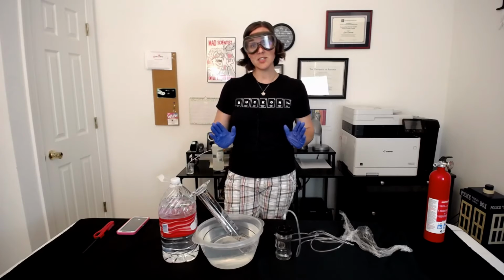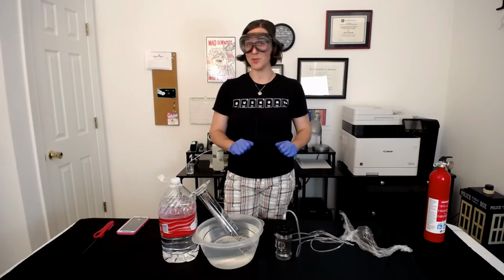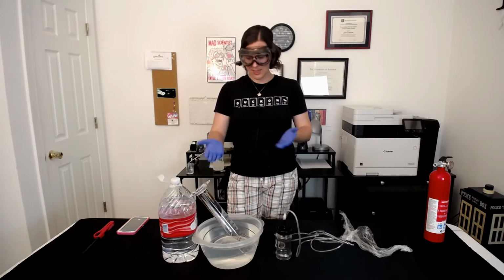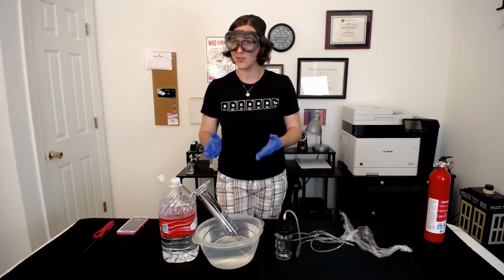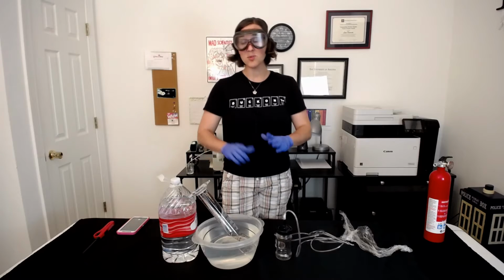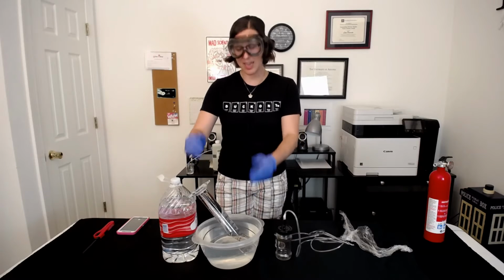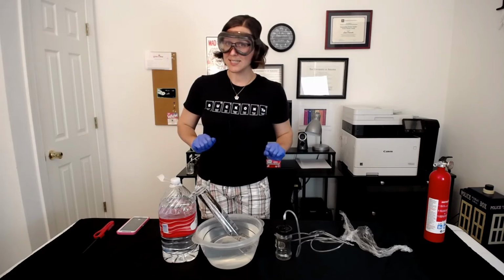The next thing we need to know is, where is the actual meniscus starting in our graduated cylinder? You may have accidentally lost some water when you inverted it, so we're not assuming that we have 250 mL here. Remember, we filled the water up all the way, so we have more than 250 mL capability in this container. Let's get it eye level and make sure we know where the meniscus is to start.